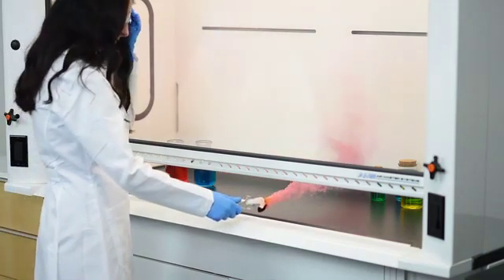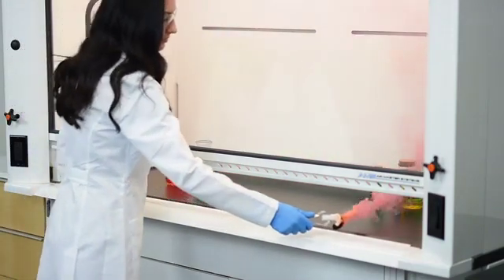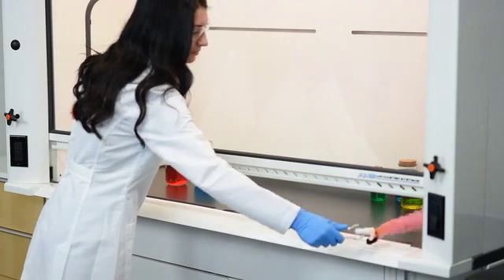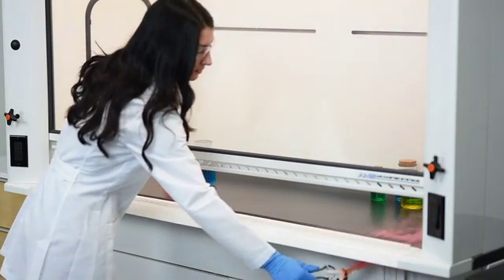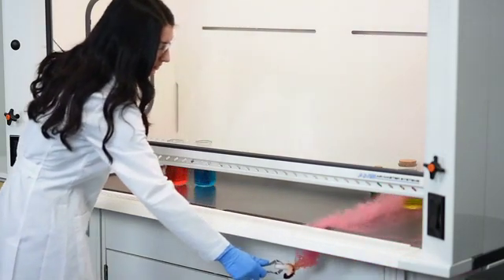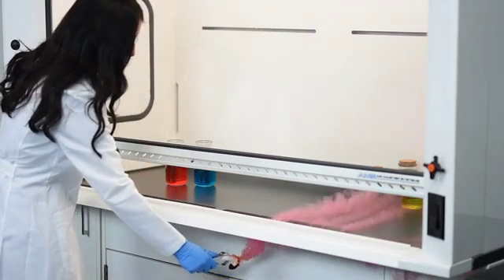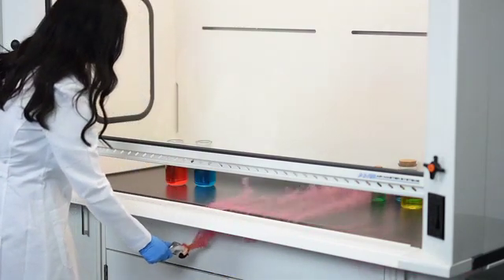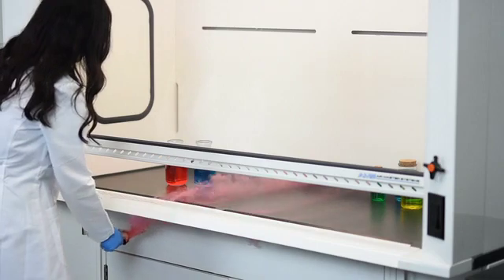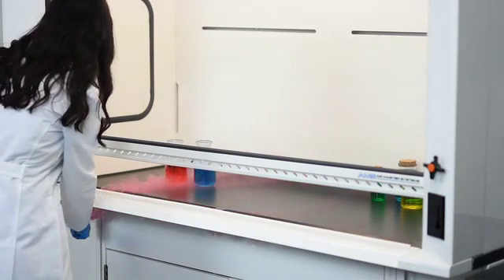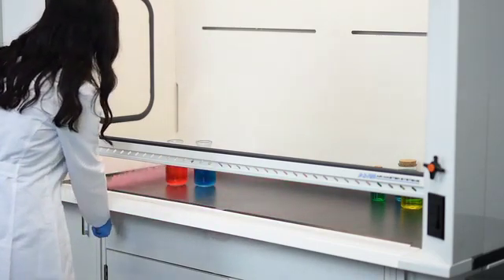As you can see with our fume hood, the room and the fume hood are both balanced very well. As Marissa is bringing the smoke back and forth, it is functioning no matter what height we have our sash set to. This is a very important thing when you have your laboratory set up correctly. Remember, this should be done in advance before any research or experiments are performed in this fume hood.